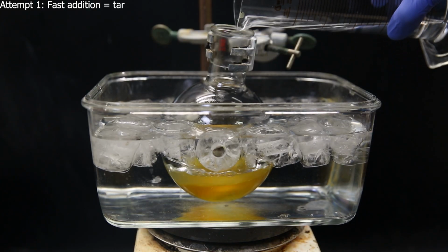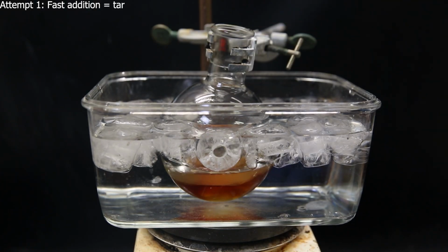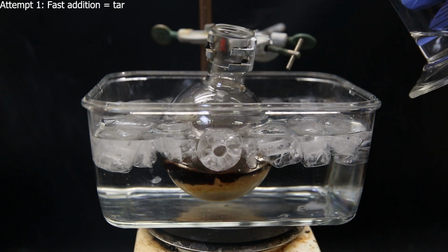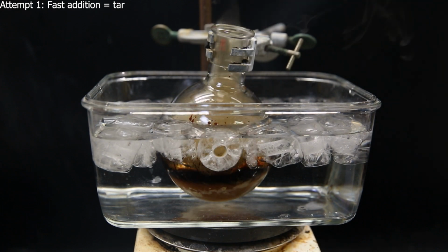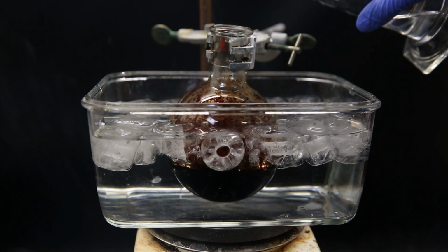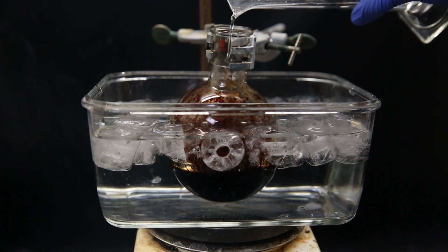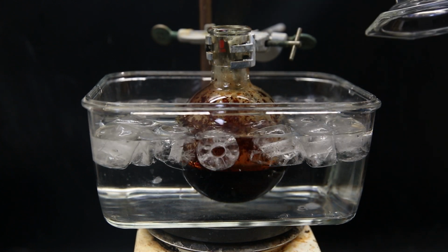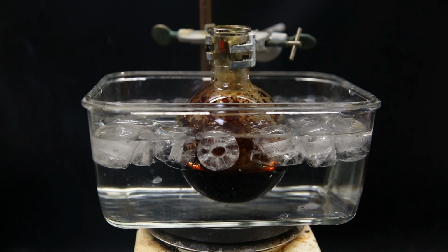In my first attempt, I followed literature which said they added nitric acid to a cold mixture of mesitylene and sulfuric acid, but they wrote it like they added it relatively quickly. It sounds kinda stupid, but I thought maybe mesitylene is just special. So anyhow, I tried that, but it forms a lot of tar, because the reaction warms up quickly from the addition, which causes a lot of side reactions to happen. So let's see if doing it like these illiterate people can still yield some product.